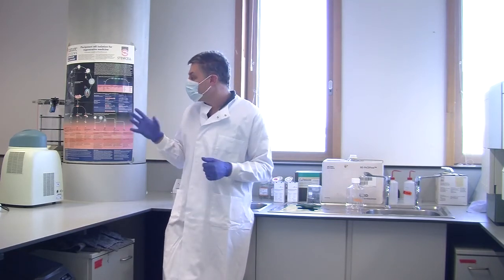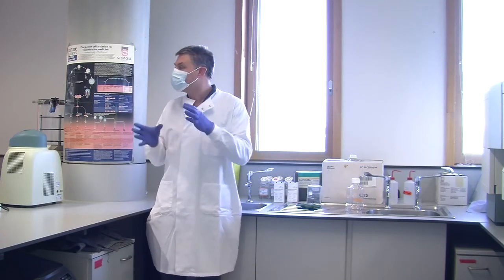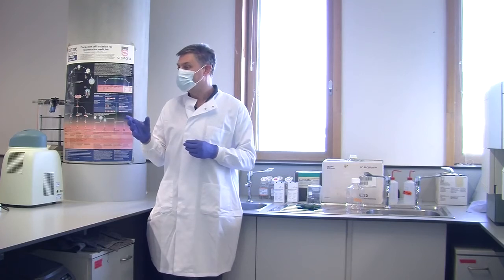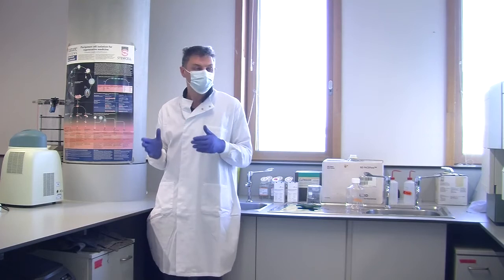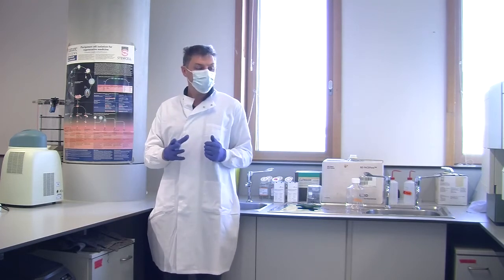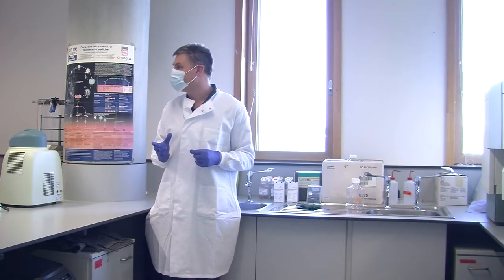So what we'll do is we'll label our cells up. If we can keep reasonably synchronised, I know it's difficult because we've only got limited centrifuges and various equipment, but we'll get them labelled up. Are you all familiar with the antibodies as well? Do you want me to cover antibodies? People, all right-ish?